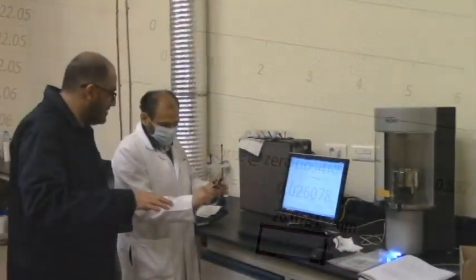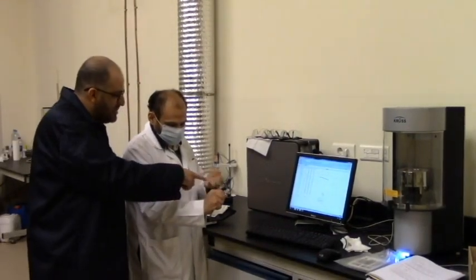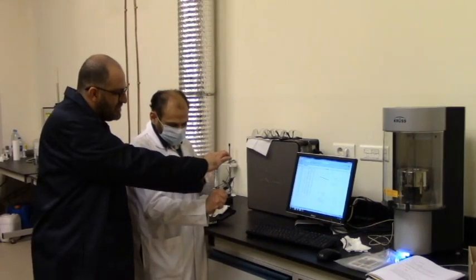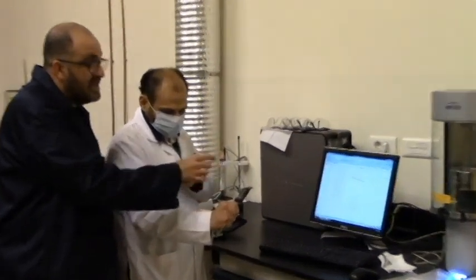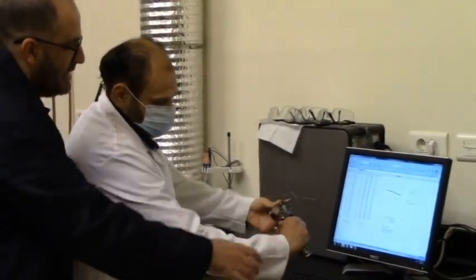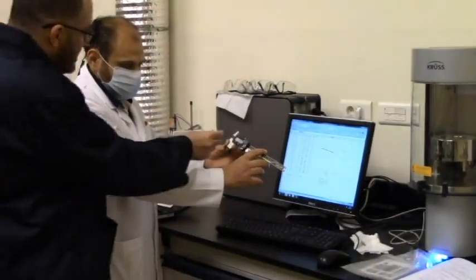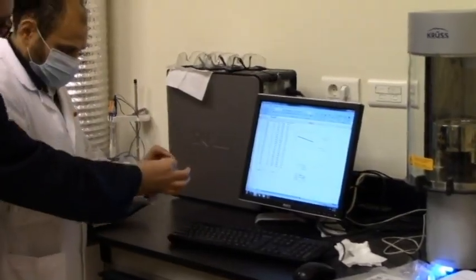So now after putting the N-heptane back into its graduated cylinder, I'm happy without the mask. So this is a caliper. I'm measuring the thickness, with the help of Tony, and the width of the plate to make it sort of a double check on the wetted length we got from the experiment, and this is already there in your manual. So the thickness here is 0.25 millimeters. What about the width?